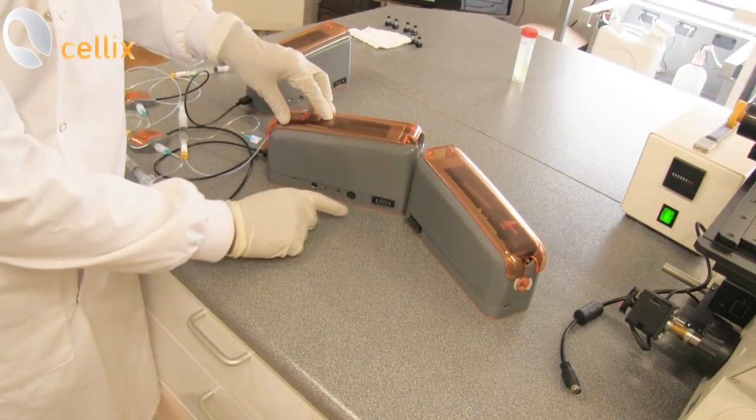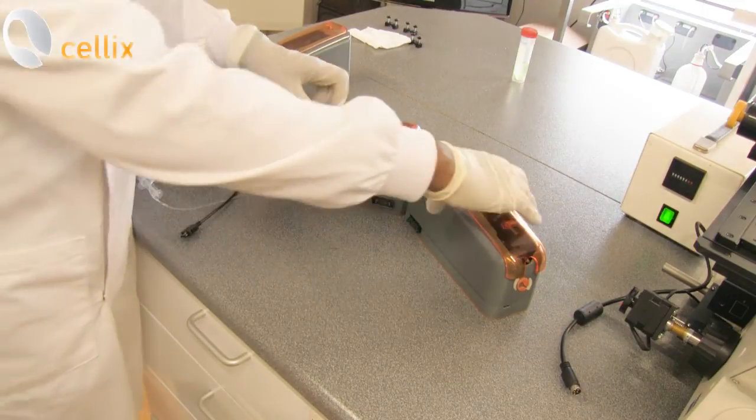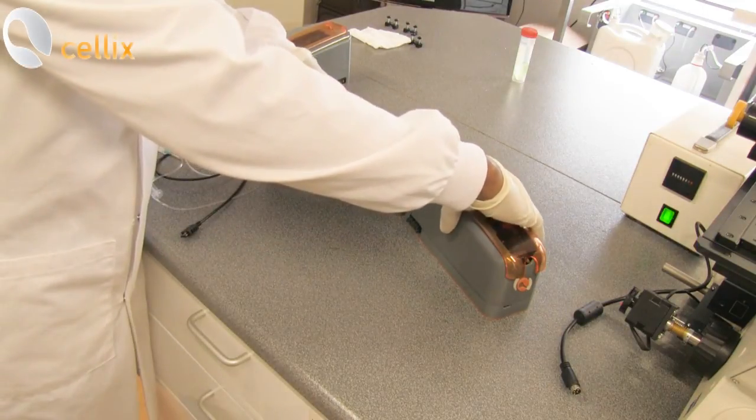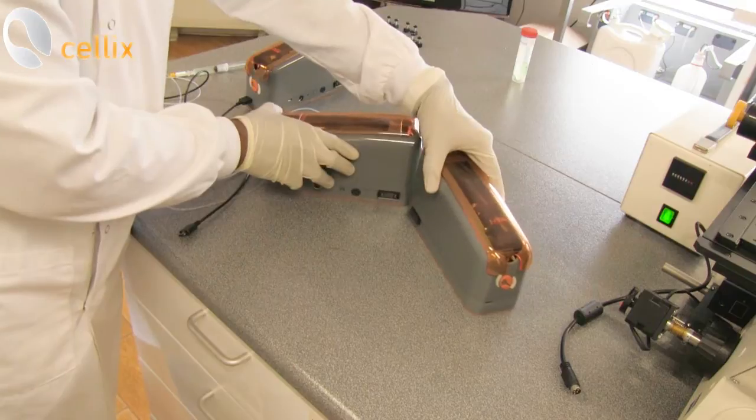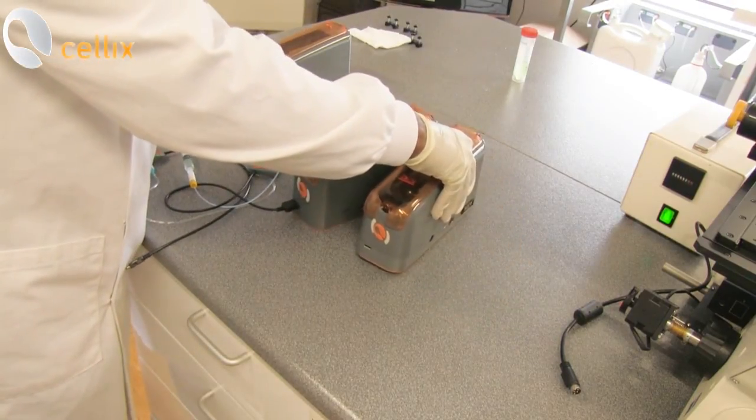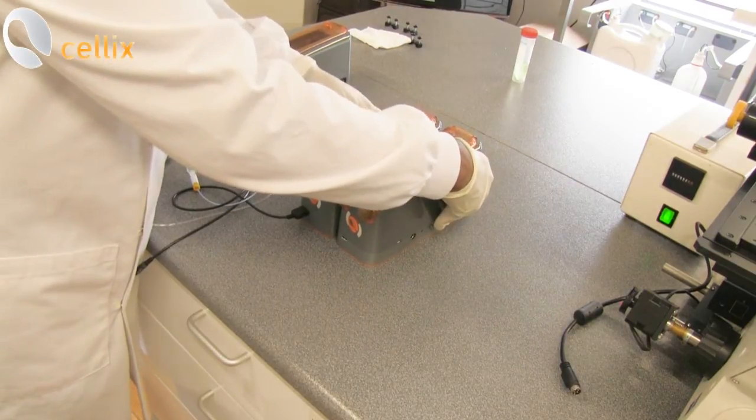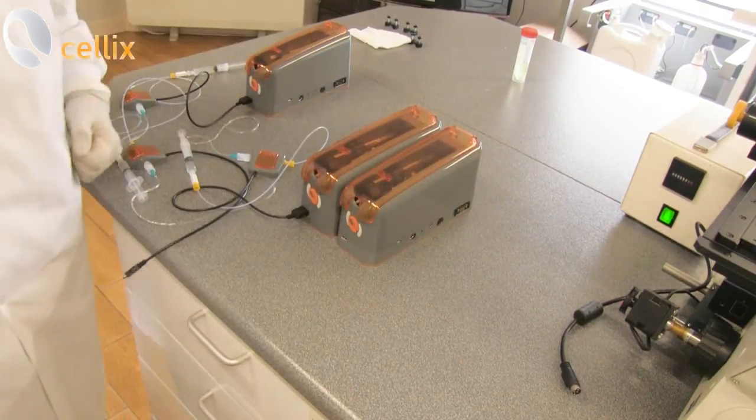So these are the two pumps. Here you can see the male connector and the female connector. To connect both pumps, you gently connect the male connector to the female connector. So you have the two pumps ready.